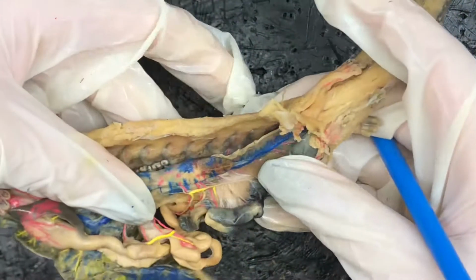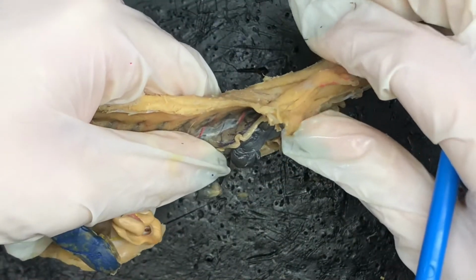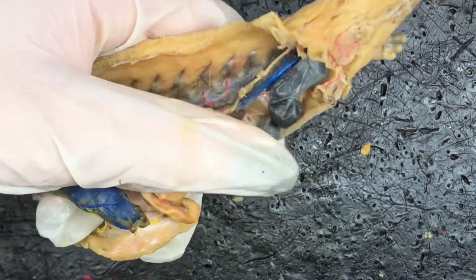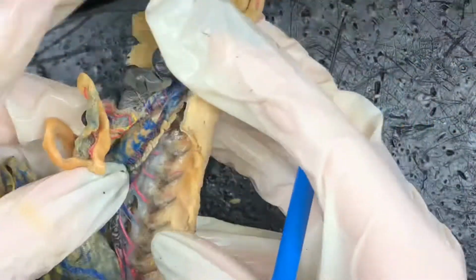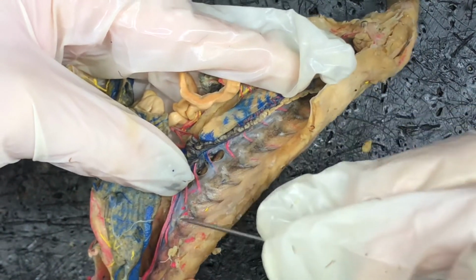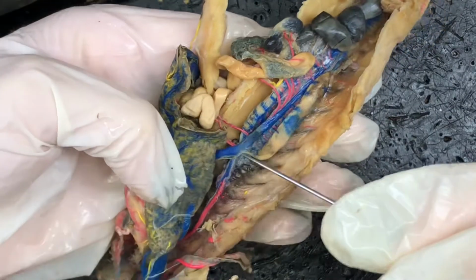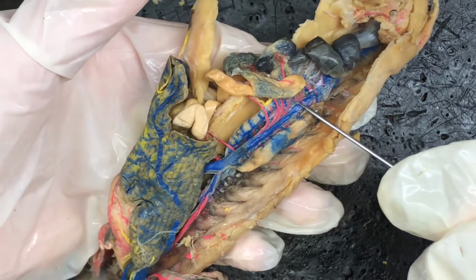We have a renal portal vein, which runs on the bottom of the kidney. So we can flip that kidney over. As you can see, this little dark vein right here runs all along the kidney. That is the renal portal vein. We have the intersegmental artery and vein running here. These little arteries and veins running here into the body wall are the intersegmental arteries and veins. We have the posterior vena cava, which is this vein right here. This big vein that runs through the body is the posterior vena cava.